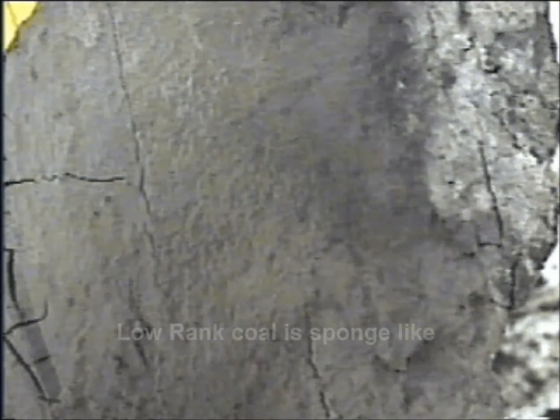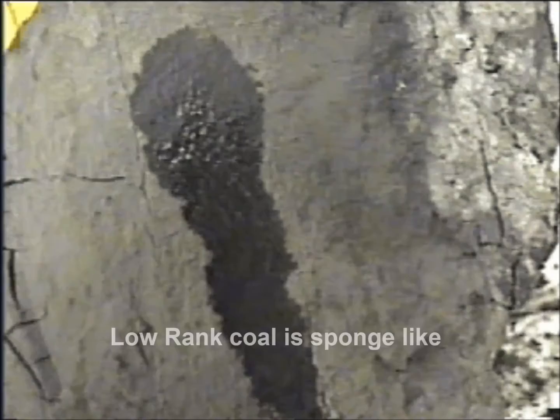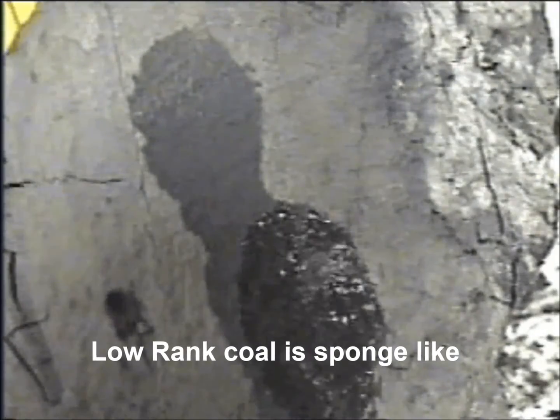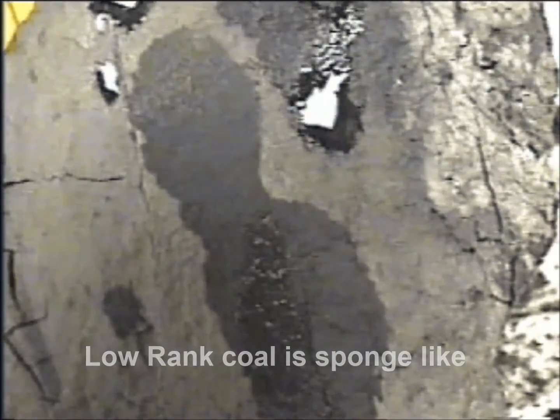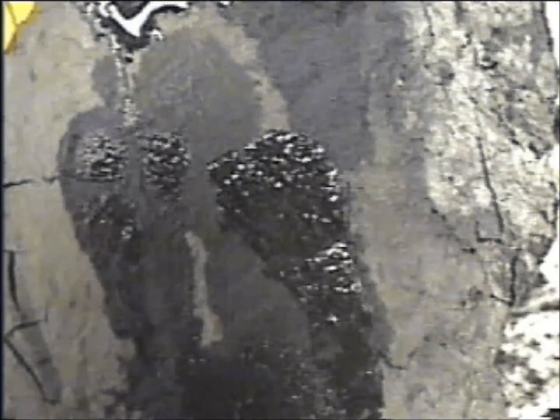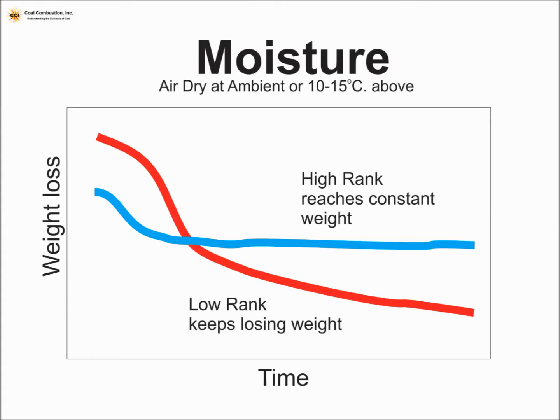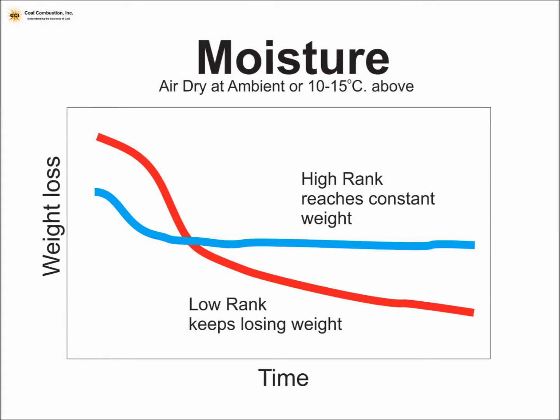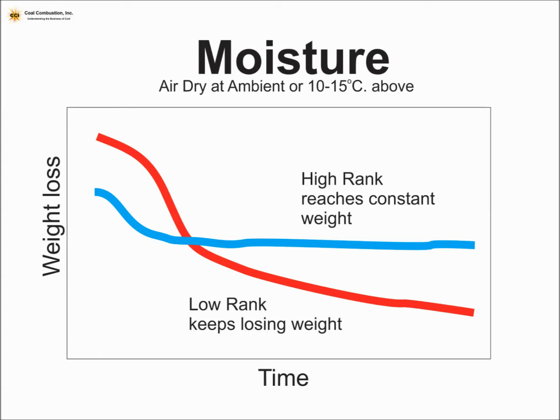Here's an example of dried lignite that I'm adding water to, which shows it's very hard to define a surface moisture versus an inside moisture for these low rank coals — this is that sponge-like behavior. What it means is the coal will keep losing weight in the air dry loss moisture test over time. This chart shows that effect, where the blue line represents bituminous coal losing the surface moisture and staying at a constant weight, while the low rank coals continue losing weight.